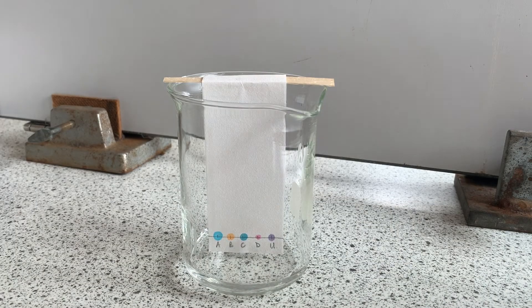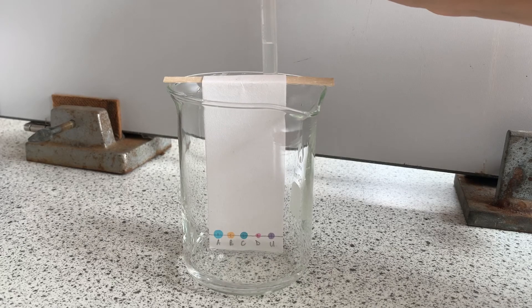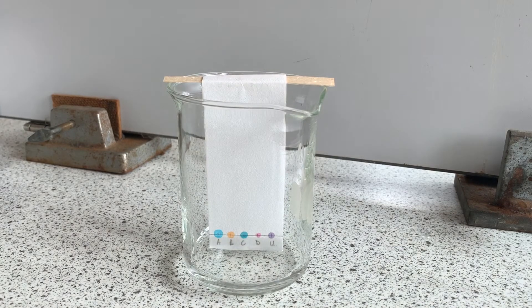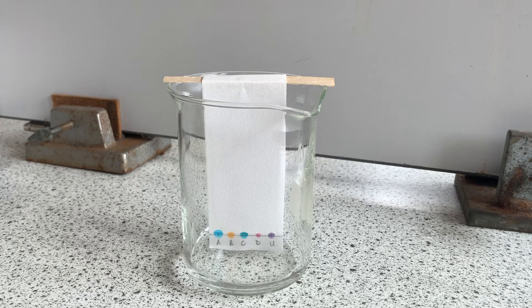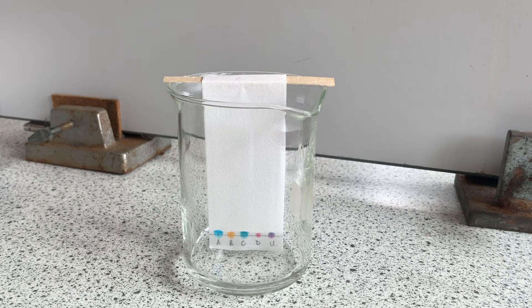Now I'm putting a small amount of solvent carefully into the beaker. The solvent needs to be touching the paper but you don't want its level to go as high as your starting line. The solvent in this practical is water.